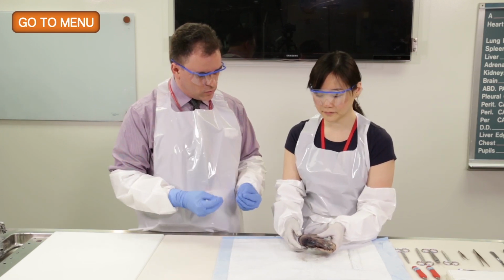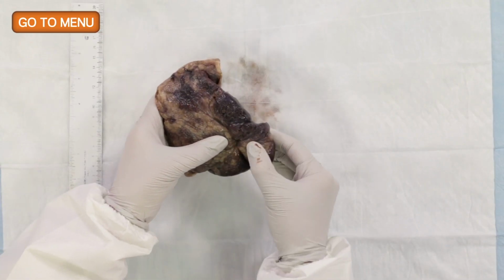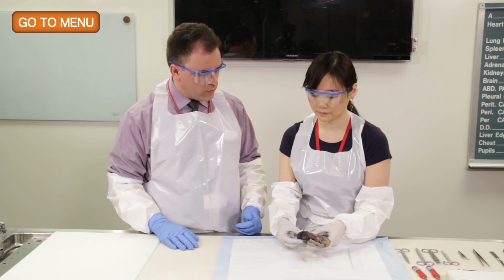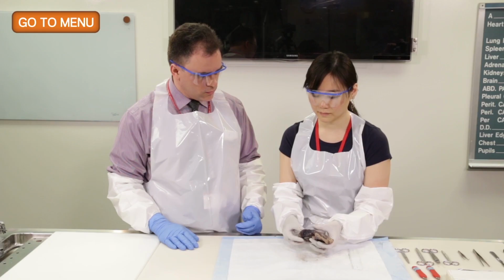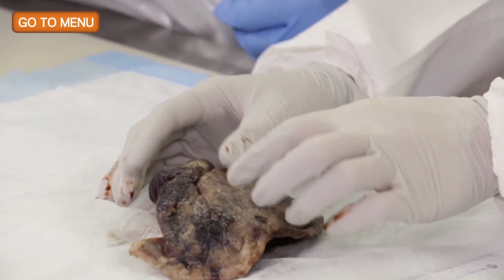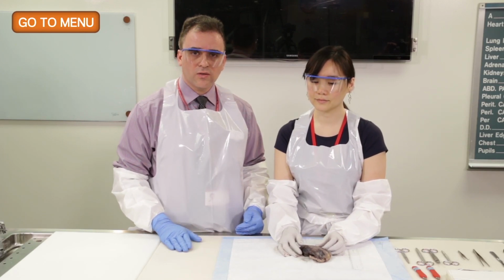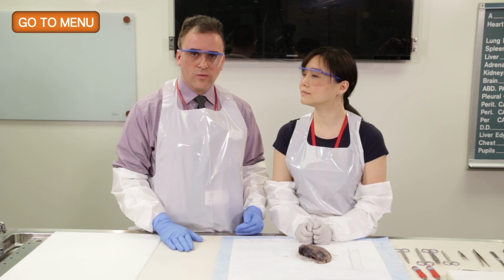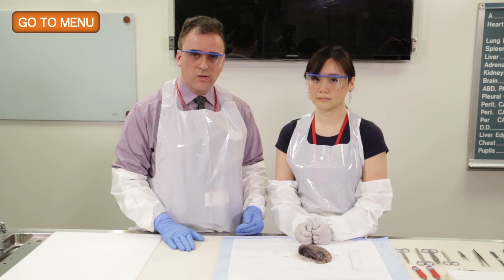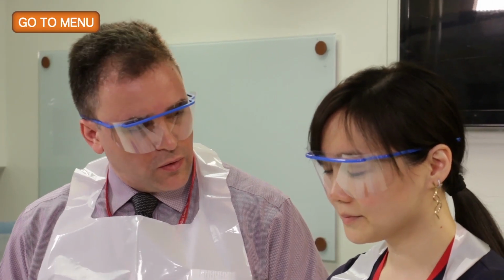And so as you're holding the specimen, can you feel the edges of the tumor mass? I can. So you have an estimate right now of in which direction is the largest dimension? Yes, I do. Okay. It should be this. So that'll impact our ability to measure the tumor. We need to know, if it's an irregularly sized tumor, that we can measure the largest dimension, because tumor size is the number one important parameter that we need to determine during the gross evaluation. What other elements do you need to look for at this point?